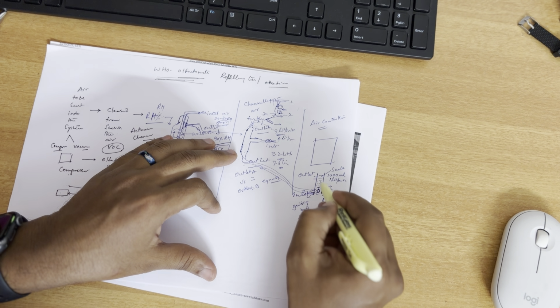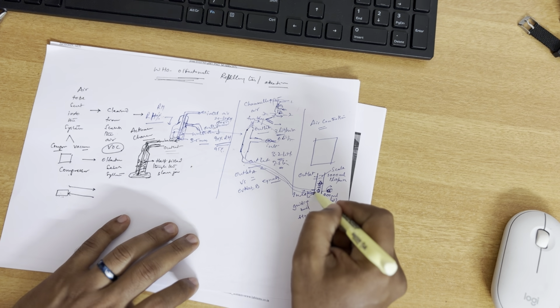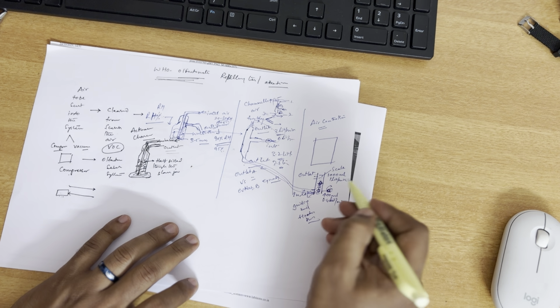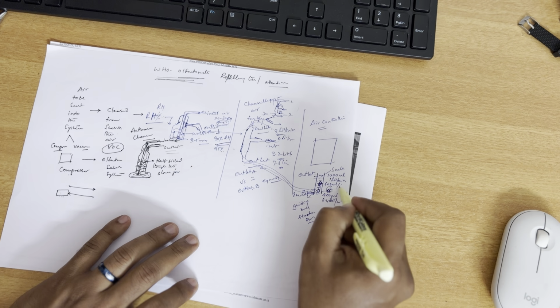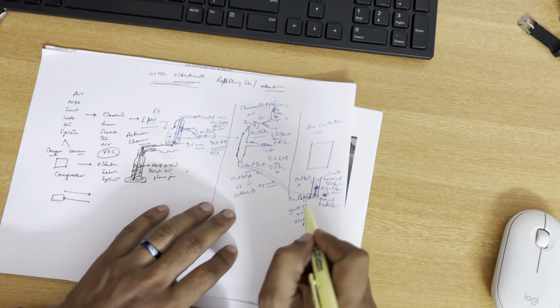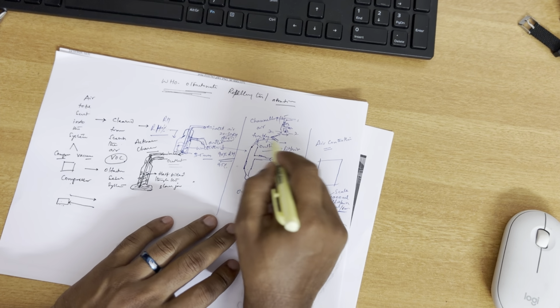You see the markings here. Say for example you want the knob to be here, so you are sending this floating ball here, and then you are stopping it. It means that the air coming here, while it is going out, is being regulated. It is regulated at your desired level, maybe around 600 ml per minute. So this is the standard output that you have set for outlet A, and you want to do the same thing for the other outlet.